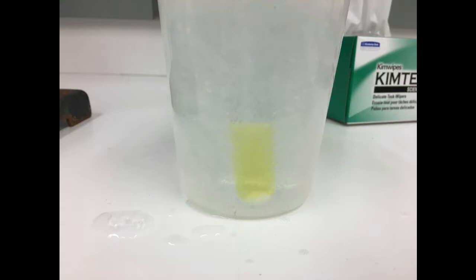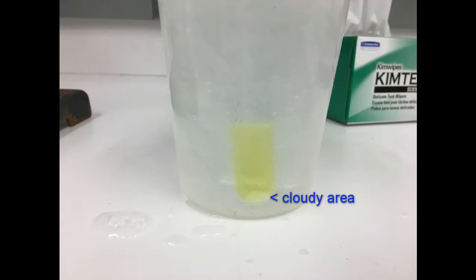Once crystals begin to form, which looks like cloudy areas in the solution, continue to let the caffeine fully recrystallize.